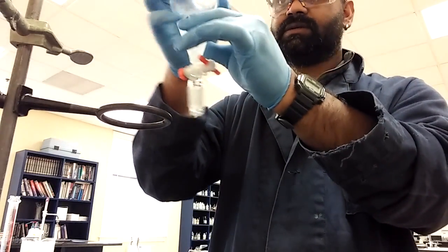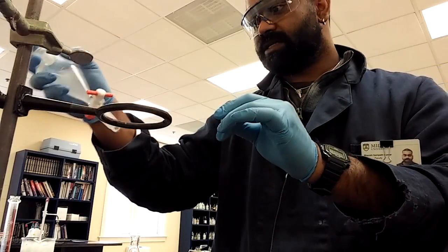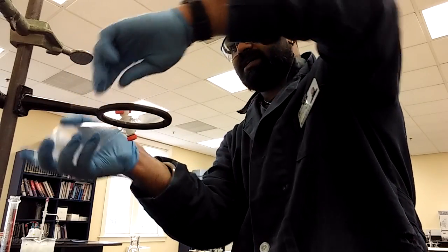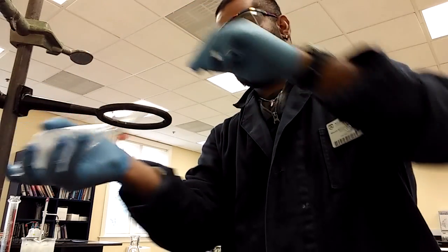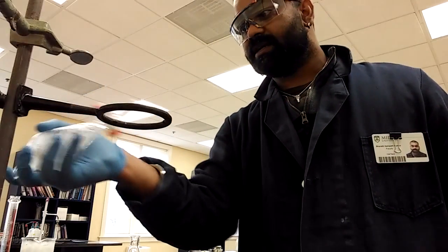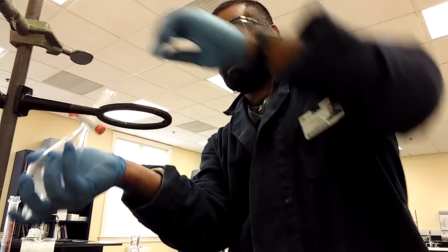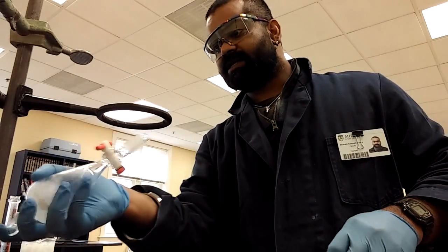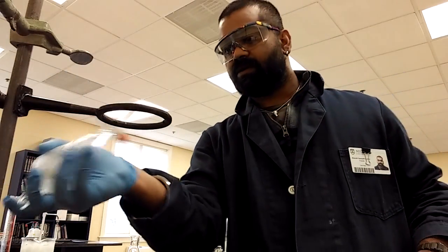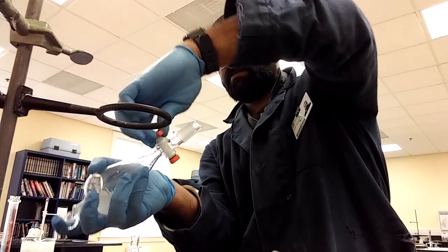Shake it. I must have a leak in my... Ooh, you see that? You gotta frequently vent. Don't shake for 5 minutes and then vent. It's probably gonna explode by then. And I'm doing it completely in this direction because I think my valve is slightly leaking. So I don't want to lose any more of the reactant mixture. So I'm just shaking. See, I'm frequently venting.